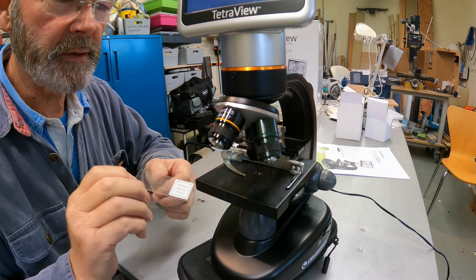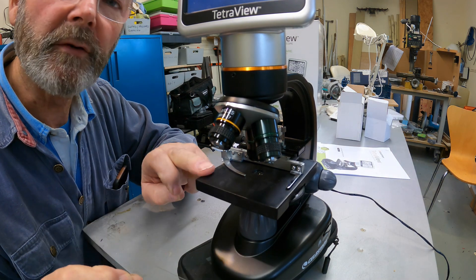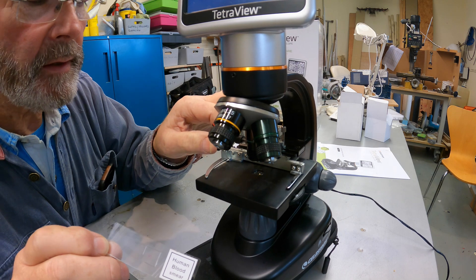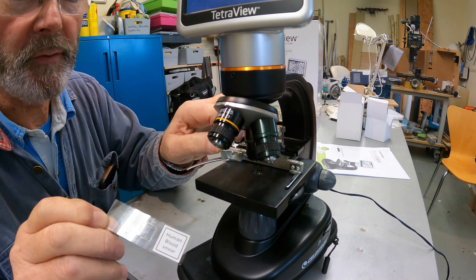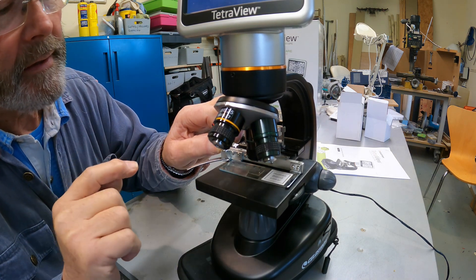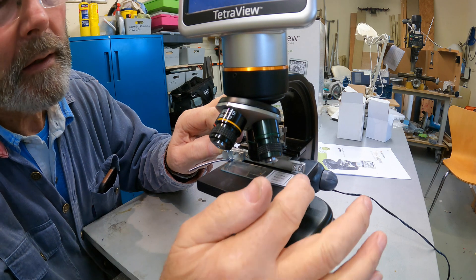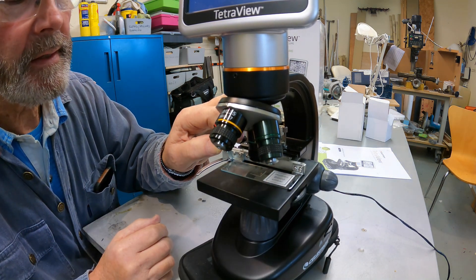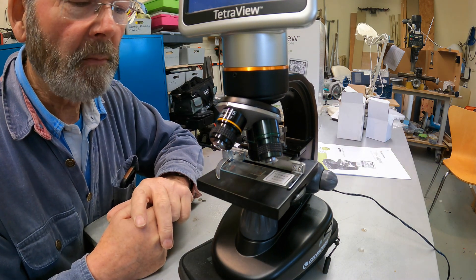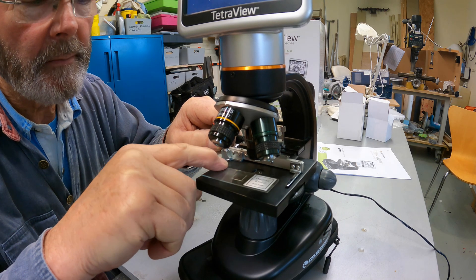The very first challenge was how to fit the slides onto the stage of the microscope. With hindsight, it's very simple. You've got this arm on the side that's spring loaded, and you pull it out like that. The slide is pushed up to the back of this fence here, with the crossbar on the end of the slide pushed into there. Then this arm closes and holds it in position. To take it out, just operate the arm and pull the slide away.